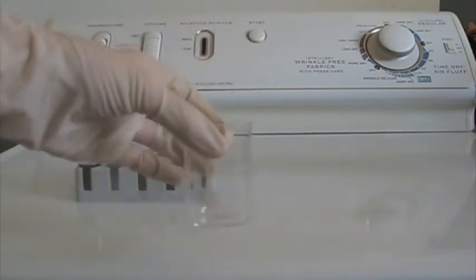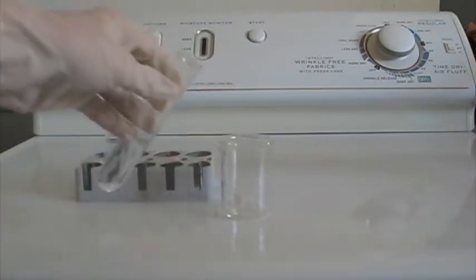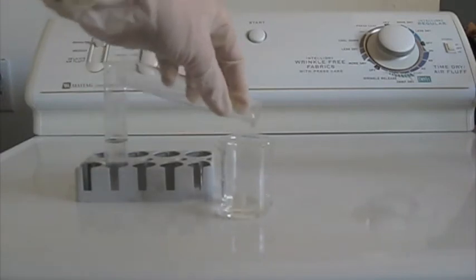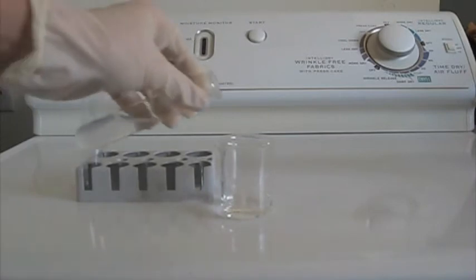Here's my reaction vessel. Solution A and B are mixed in the reaction vessel. Both appear to be clear liquids.